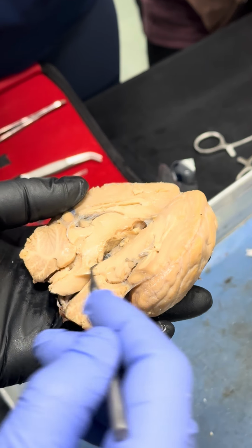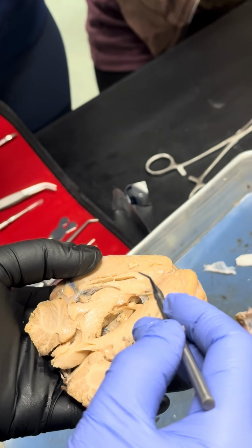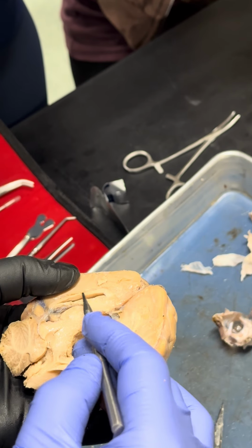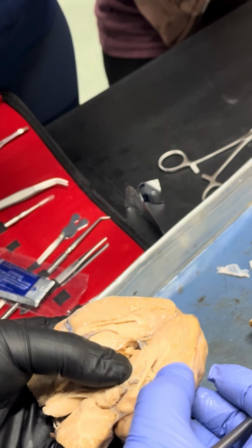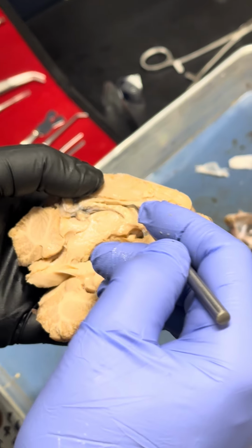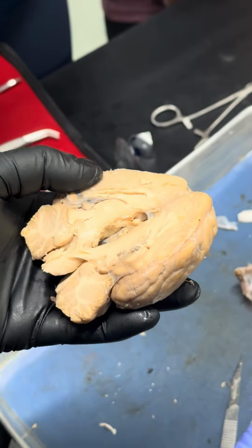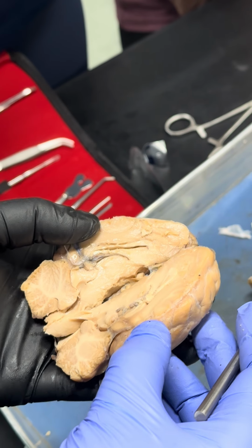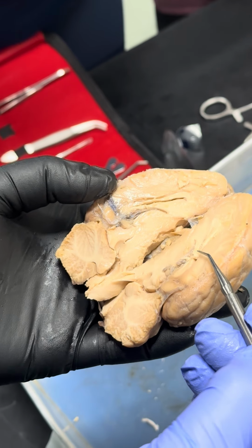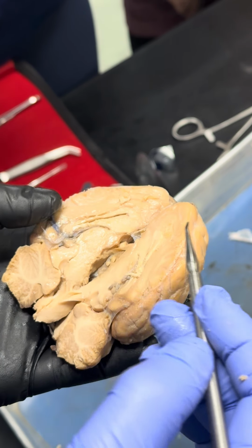Medulla dissected already. So I want to show you some structure inside the brain. See, this is a structure, right? Above this structure, what is this one? Corpus callosum, okay? This is a corpus callosum, see right here. Above this space, corpus callosum, which connects right and left hemisphere of the brain, okay? This one is called pineal gland, see right here? Pineal gland is here.